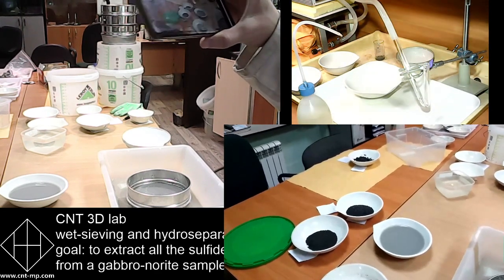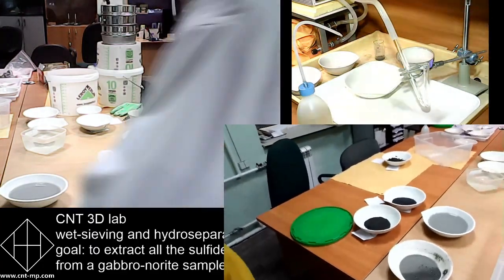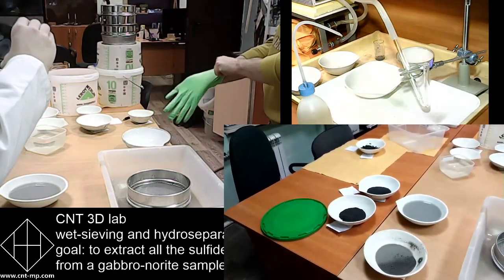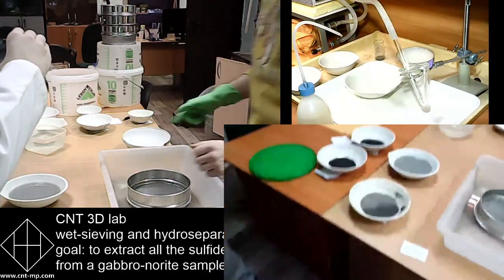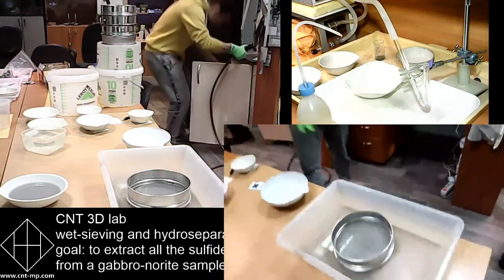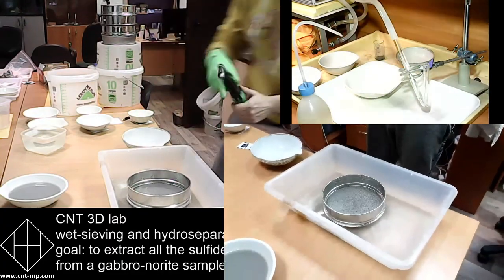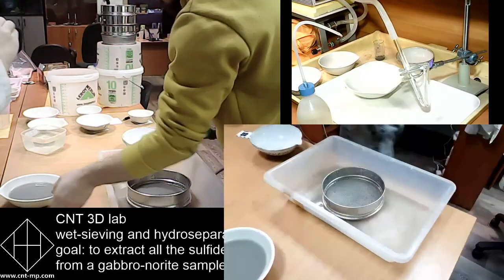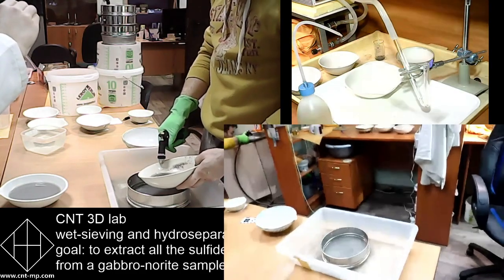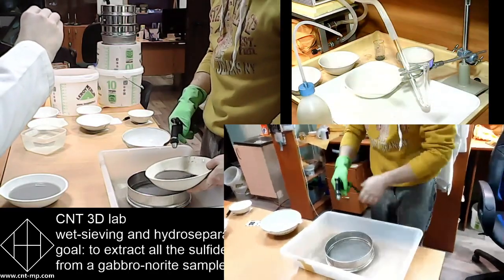Oleg will now switch the camera of the phone, so we will see. Yeah, exactly. So down below on the right, you will see the field of vision that will show the part of wet-sieving. So you see guys using rubber gloves for wet-sieving. So manual approach, as I said, is more sensitive, more adequate. We use manual approach for this one because we work with very fine grained material here. You see those sulfides.